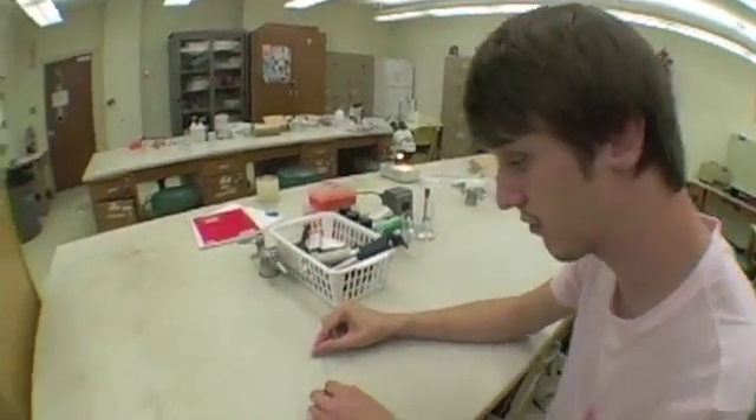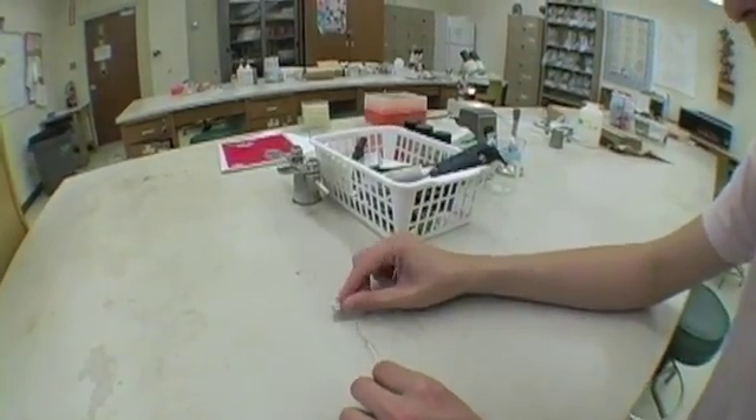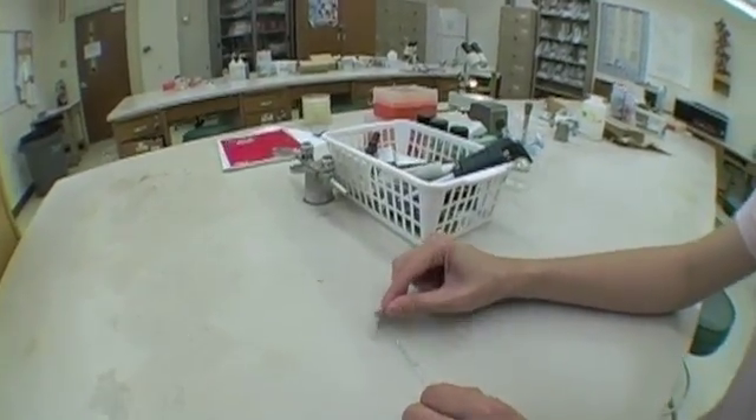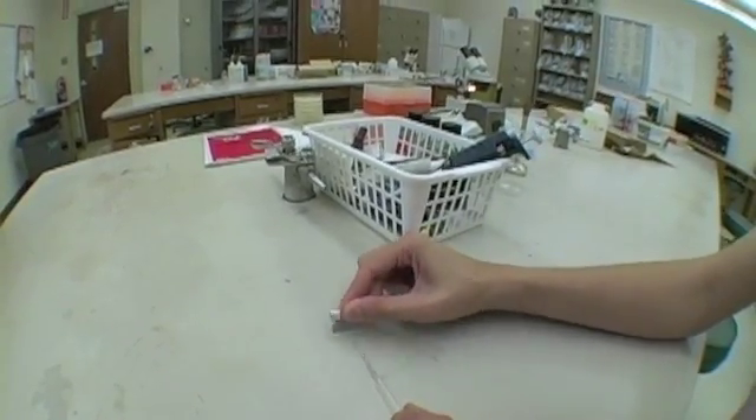After your pick is cooled, begin shaving the edge with a sharp-edged razor. Shave the edge until both sides are flat, and be careful not to cut the platinum wire or your fingers.